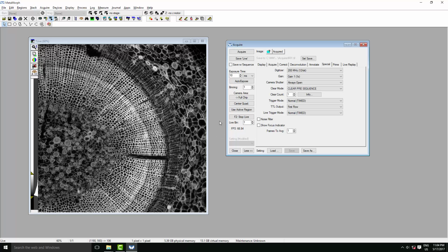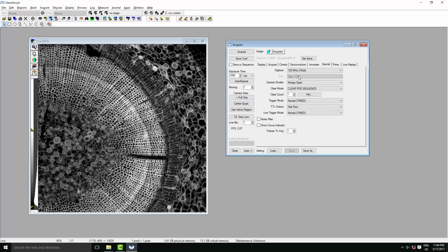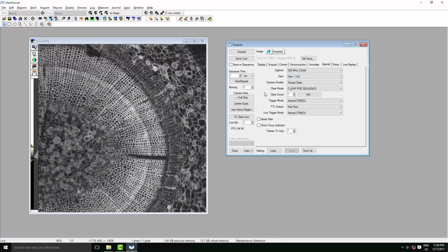Just to quickly illustrate this, if you're in the fast mode and choose a very long exposure time, say a second, here we have an image that's overexposed. Whereas if we now choose the 16-bit high dynamic range mode, we're no longer overexposed. In the 12-bit mode, which you should use when you've got fairly low signal, we have 3 different gain states in order to maximize what you can get from your signal. Gain represents the number of electrons captured per grey level in your resulting image, and gain setting 1 represents the maximum dynamic range, whereas gain setting 3 represents the highest sensitivity, so it will stretch out your histogram, and you'll make the most of your low signals with gain setting 3.